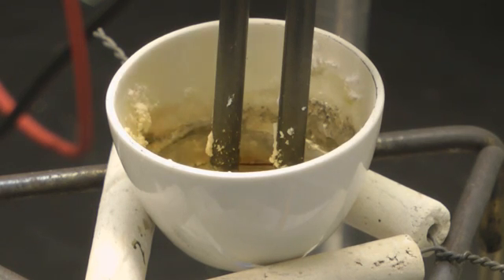Bromine is normally a liquid at room temperature, but because the liquid lead bromide is at such a high temperature, vapour is formed immediately.